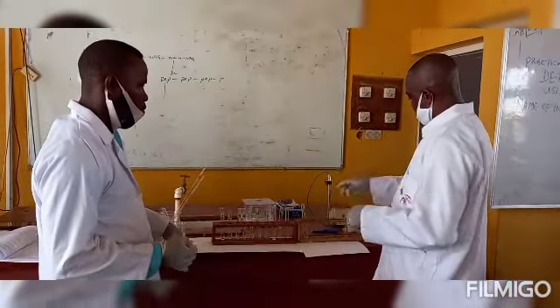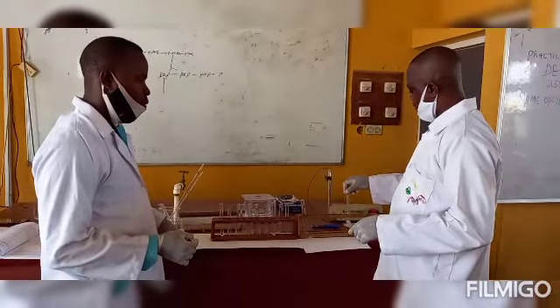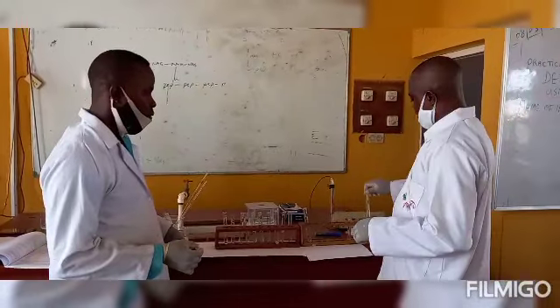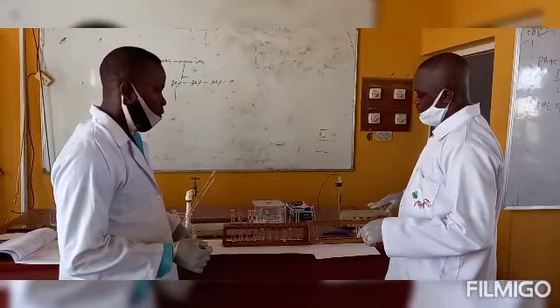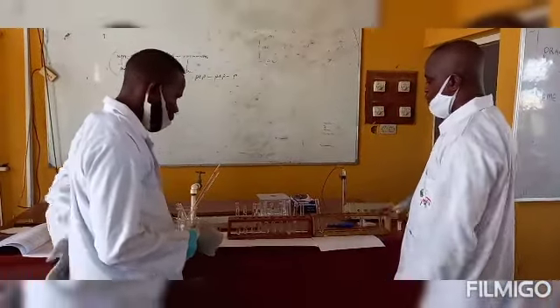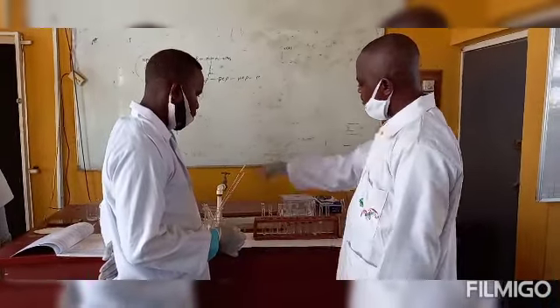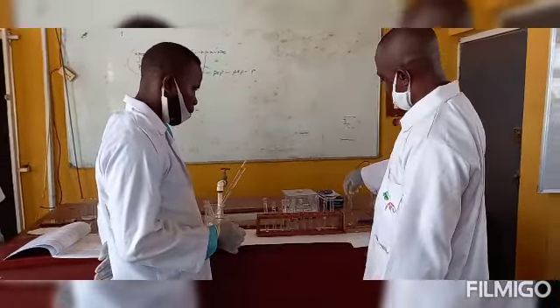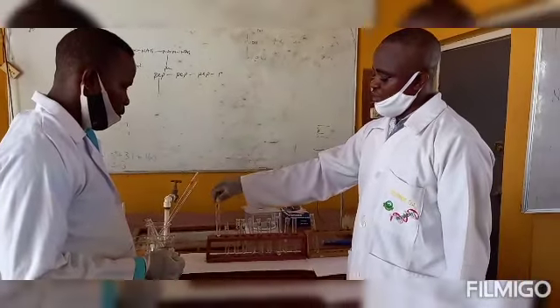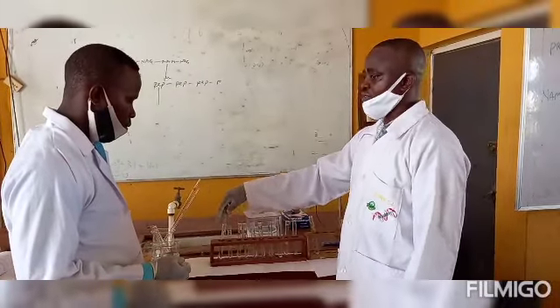1 ml of the urine was taken into test tube 12, while 1 ml of saliva was taken into test tube 13. Then 9 ml of distilled water was added to make an equal volume with the rest of the test tubes. From test tube 1 to test tube 11, if you check the total volume of solution, you will notice that it's 10 ml each.